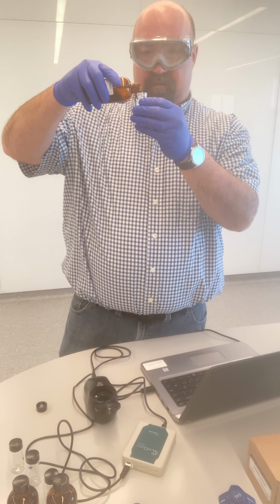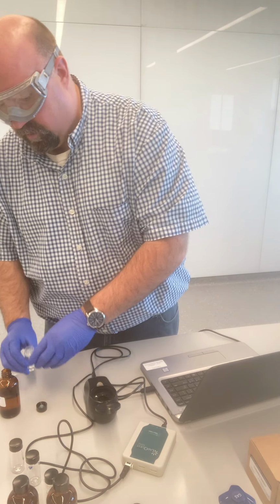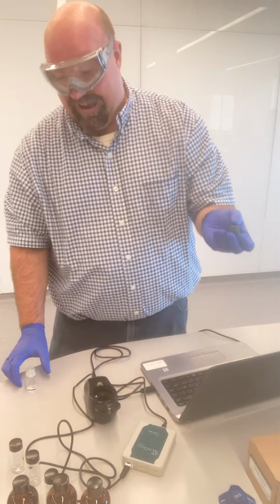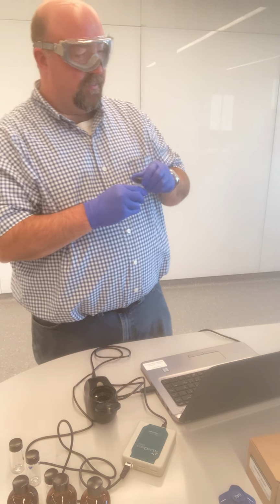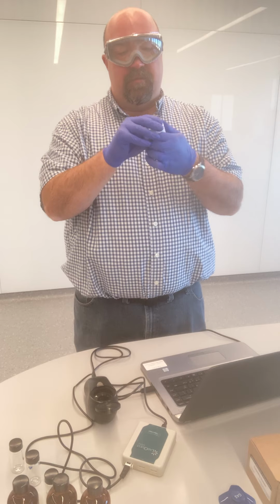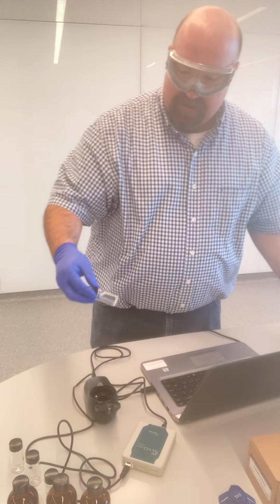Add some sample spot 1 to the cuvette. Now again, when you're writing in your notebooks, you don't need to go into that sort of detail. I'm just explaining what I do as I do it. But you certainly don't need to write down added sample spot 1 to the cuvette. That's a level of detail that is unnecessary. Again, you want to be keeping in mind that you want to write down something that would enable another 114 student to repeat this. Now I'm wiping this down and getting it ready.